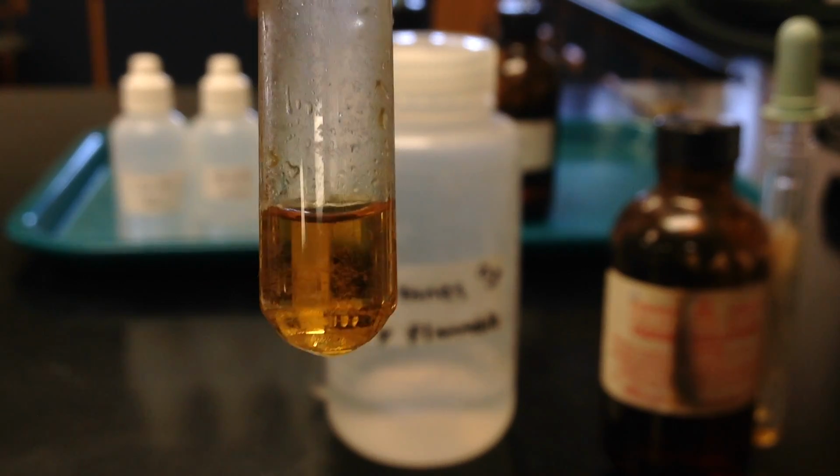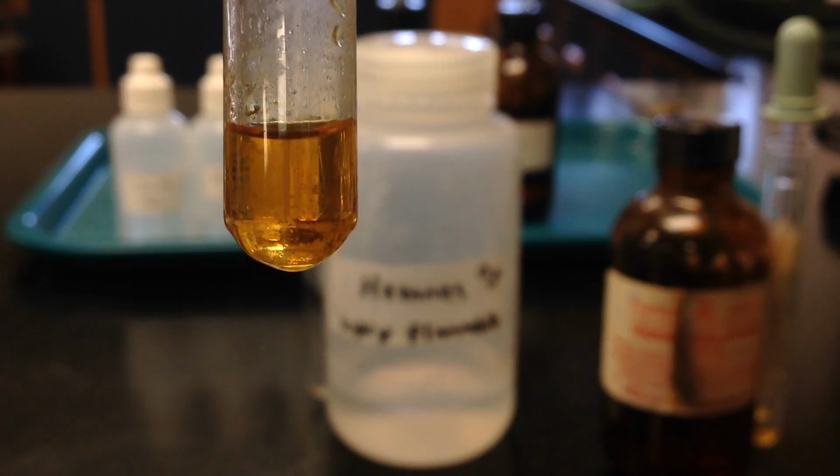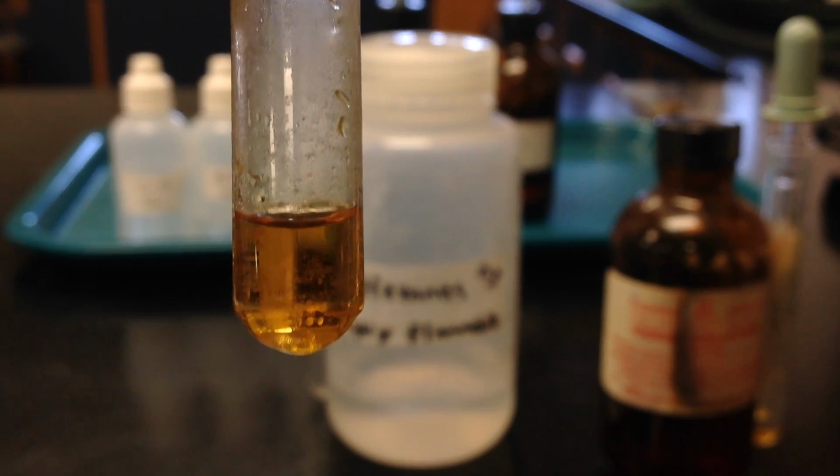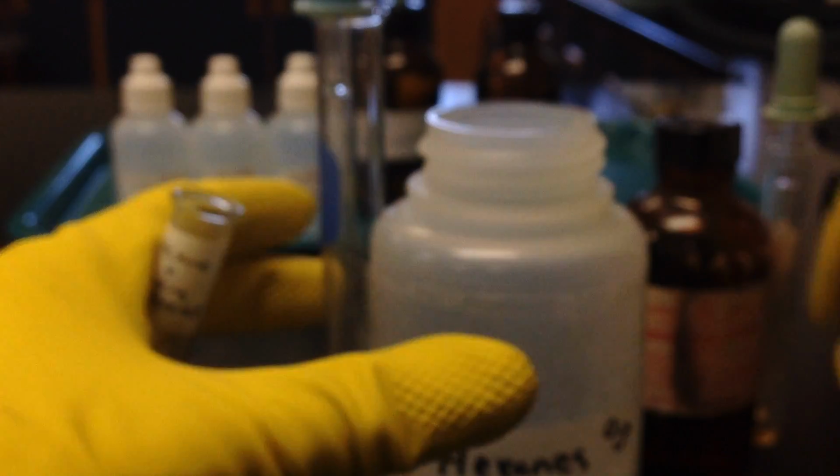The problem with this is iodine has a very similar color to bromine. So again, the whole reason we're adding that hexane layer is to try to find the difference between these two chemicals. So I'm going to go ahead and add that hexane layer now, and hopefully we'll get a distinct difference between the bromine and the iodine, so we know what we're looking at as we do the experiments.